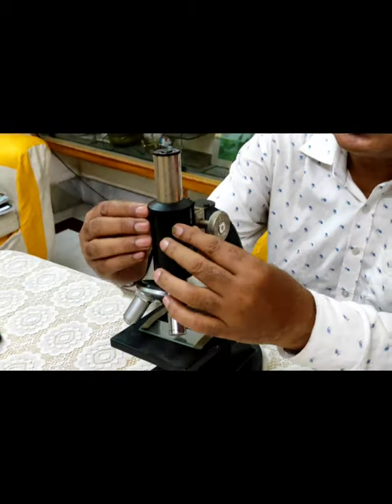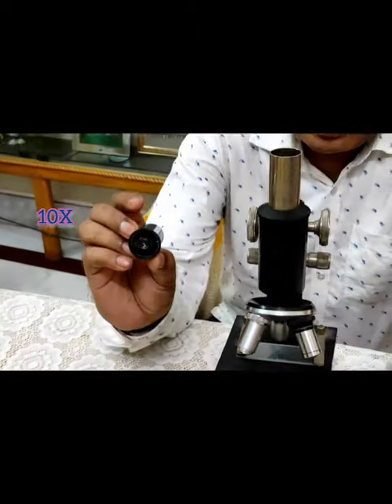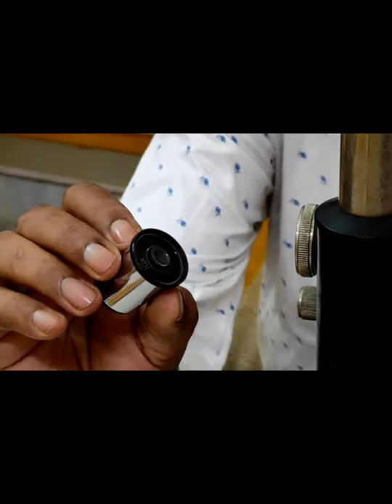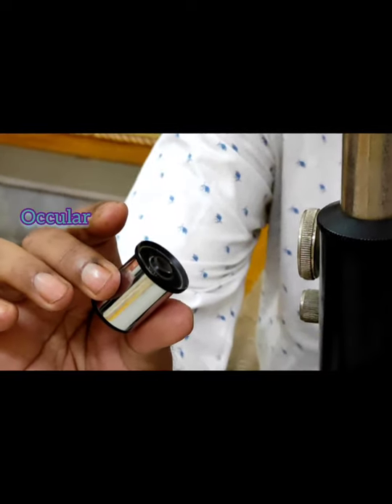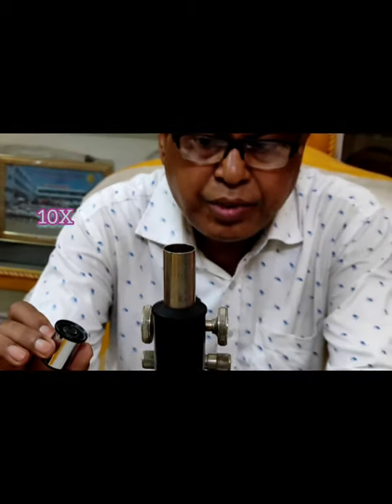On the structural part, you can see our eyepiece. These eyepiece are of 10x — it is better to say 10 times. It is also called ocular. It may be 5x, 10x, 15x, etc.